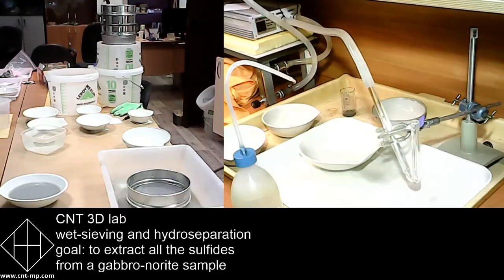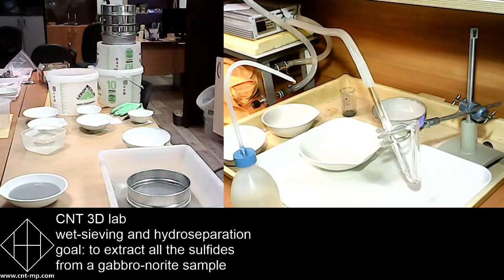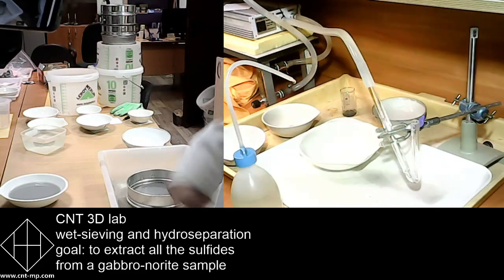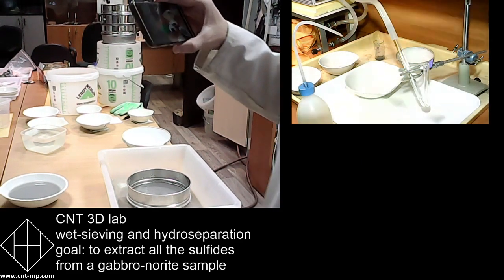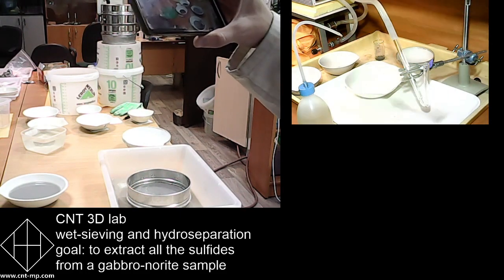So we can see 2 different fields of vision. The left one is wet-sieving part, and the right one is hydroseparation. These 2 we will have to discuss today. So Oleg will be doing wet-sieving, and his assistant Alexander will be using the camera to show you precisely how this should be done. So Alexander will hold the phone to show you guys all the different parts of wet-sieving process that Oleg will be doing.